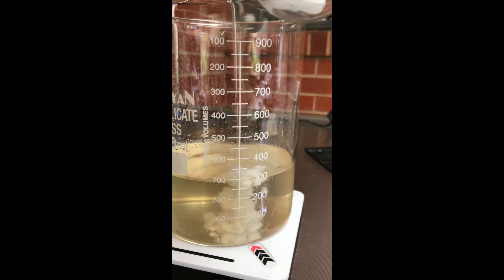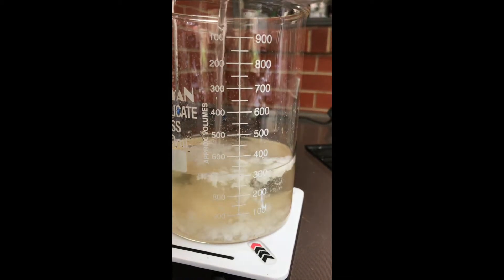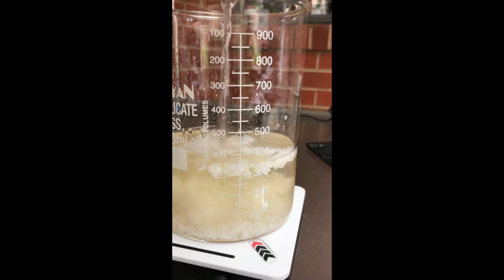Carefully add the dissolved sodium hydroxide solution to the 300 milliliters of calcium acetate solution, and you can observe the reaction.